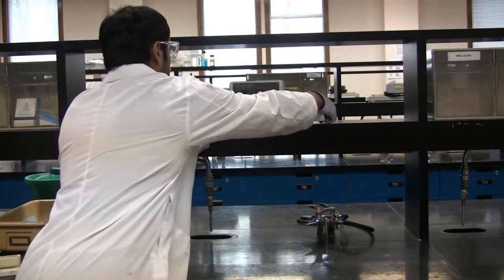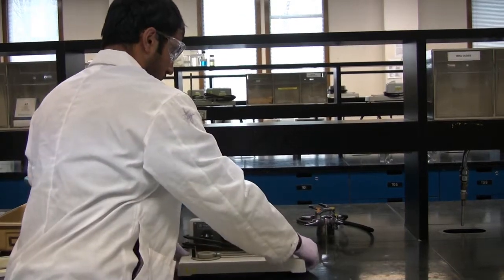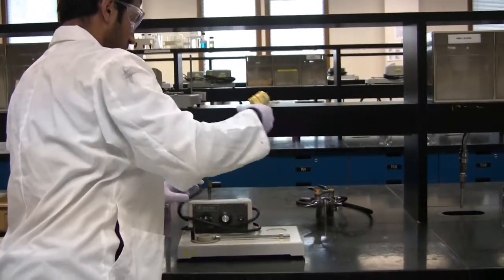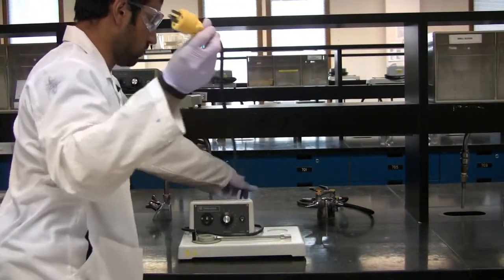Take the Fisher Johns melting point apparatus off the lab shelf in front of you. Unravel it and ensure to plug it in.